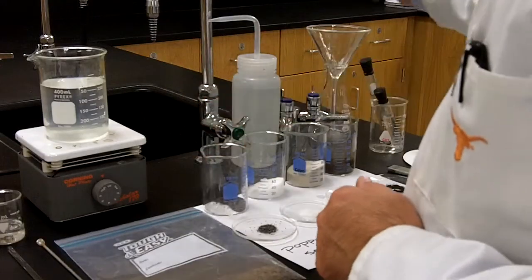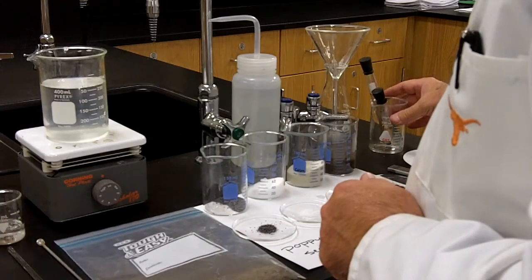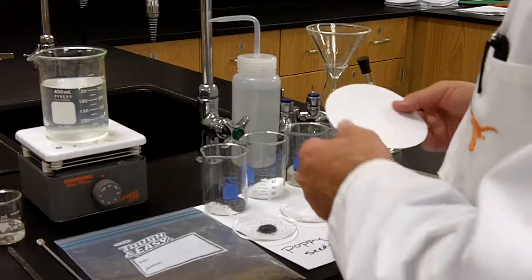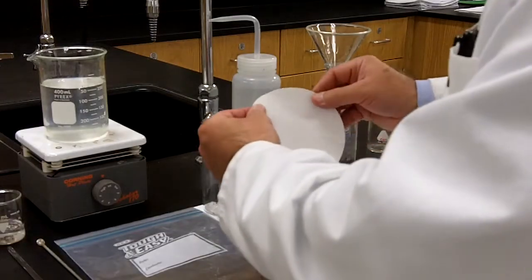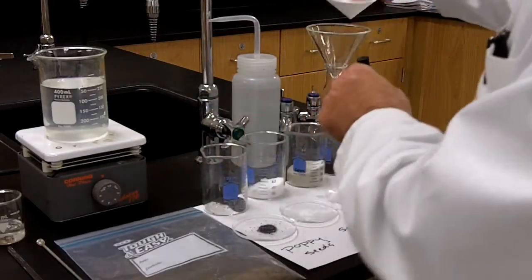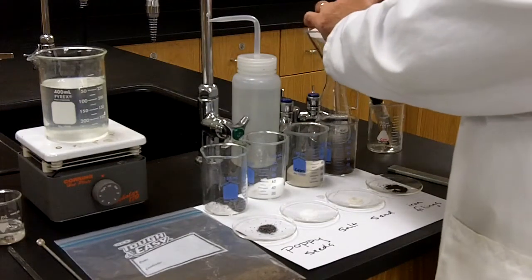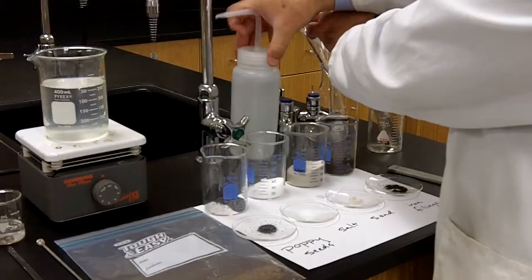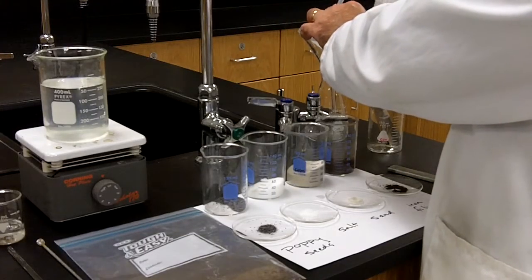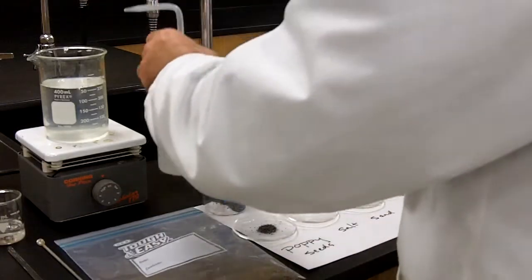You're also going to have at your disposal a funnel and flask. You'll have a beaker, and you'll have filter paper. Remember, when you use the filter paper, the technique is to fold it just like that, so that you get a nice cone. You're going to place it just like that into the funnel, and then use a little distilled deionized water to hold that funnel in place, just like that. If you want to filter something, you have that access, okay?